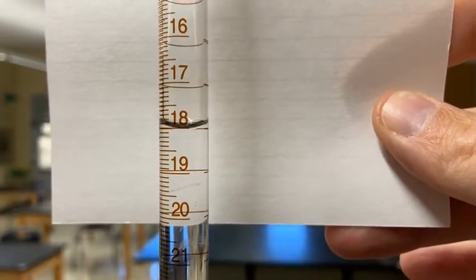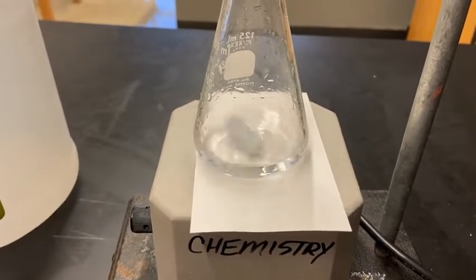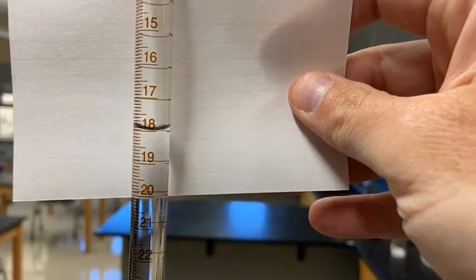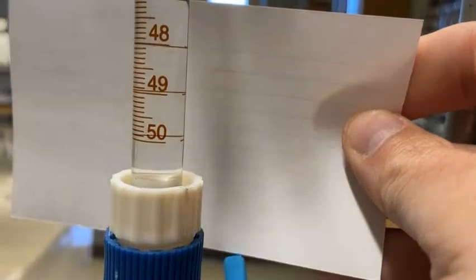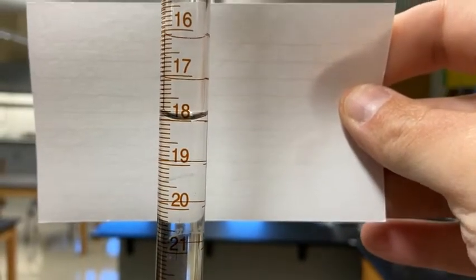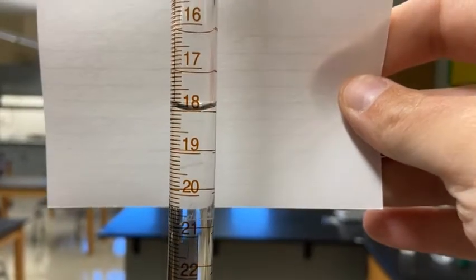That's our first trial. We're going to do two more trials, then you'll do your calculations. We don't have to reset the burette because Trial 1 only took about 18 milliliters roughly. If you look at the burette it goes down to 50, so we have plenty of volume left for a second trial. Record the current burette reading as the initial volume of sodium hydroxide for Trial 2.